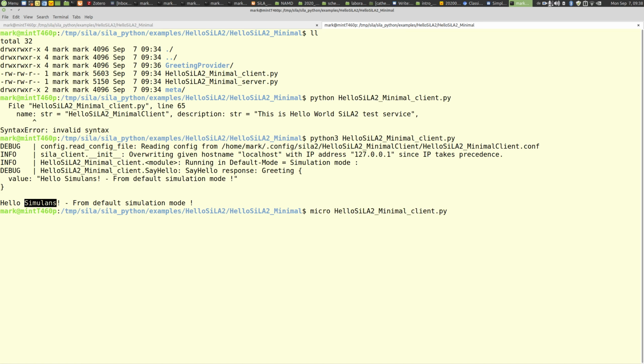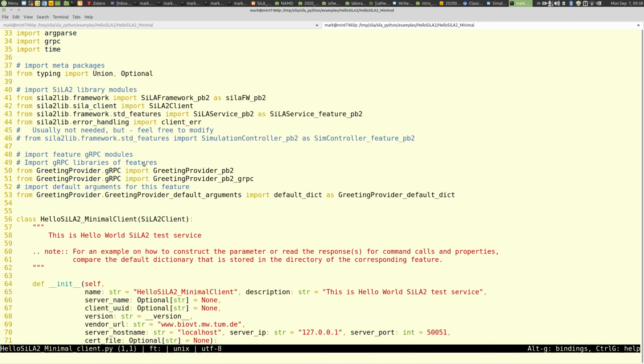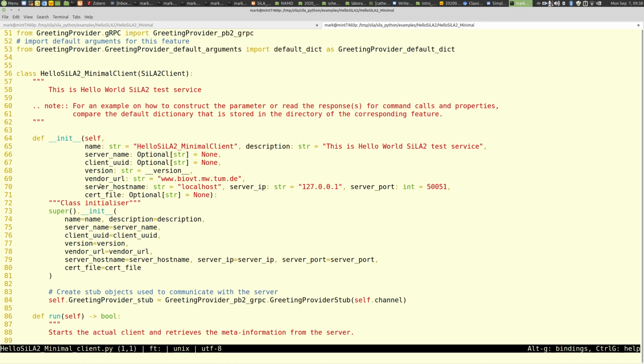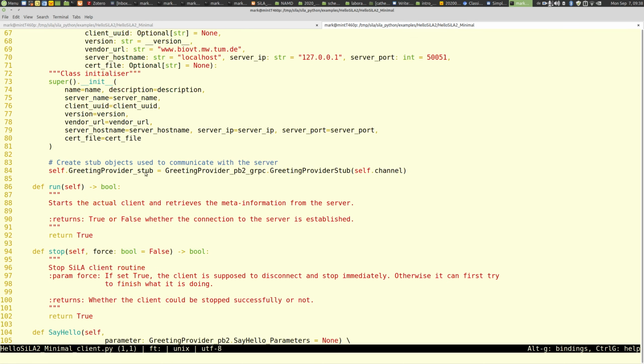Hello client, let's just have a look into the client. It's a very short code. You just include the features, precompiled features from the code generator. Then you subclass your client from the SiLA client class that we provide in the SiLA2 lib. Here's just the initialization routine of this class. Here happens the registration of the greeting provider part. So this is the feature we will connect with.